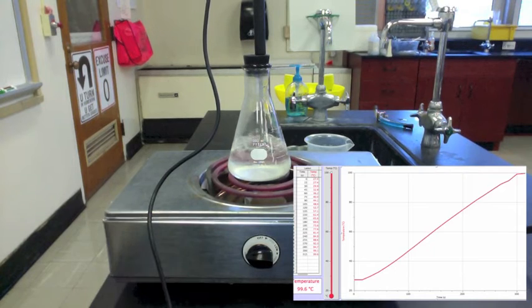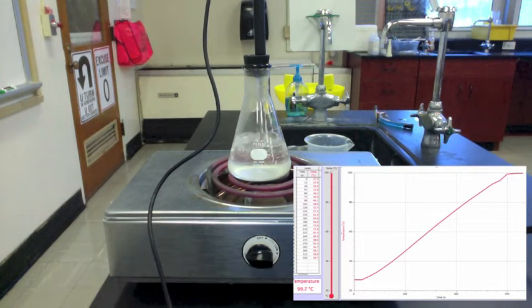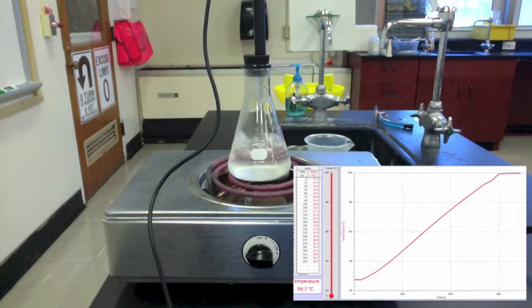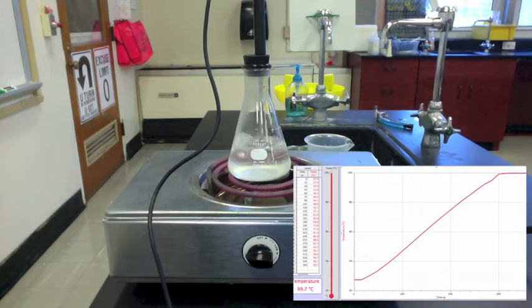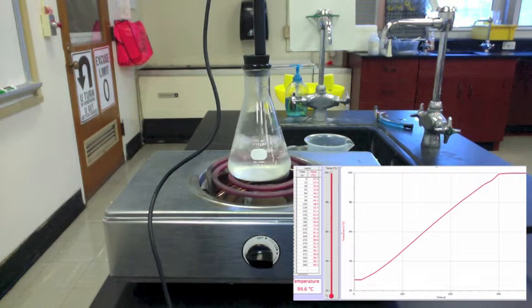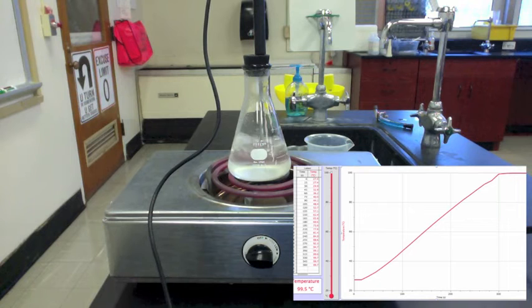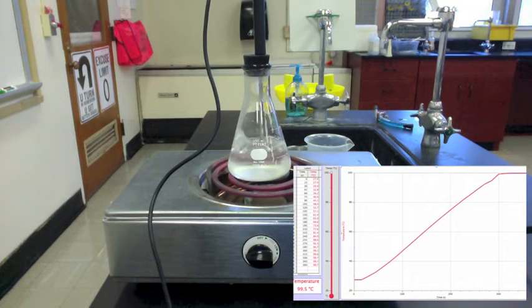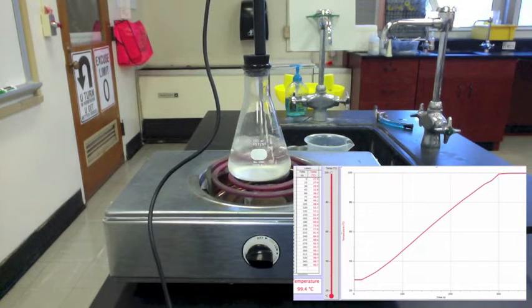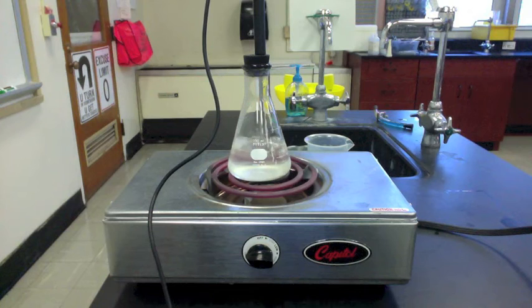We can see by the bubbles that the water has started to boil. We also see on the graph the temperature is no longer rising — it has plateaued at 99.7 degrees. We will round that to 100 degrees Celsius. The boiling point of water is 100 degrees Celsius.